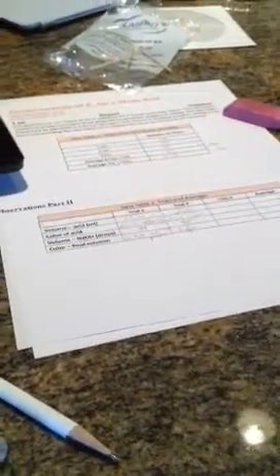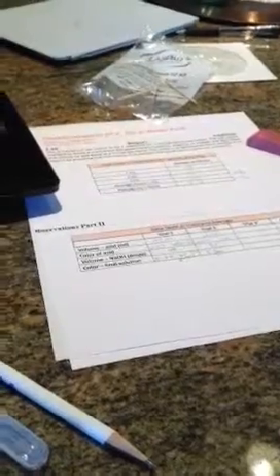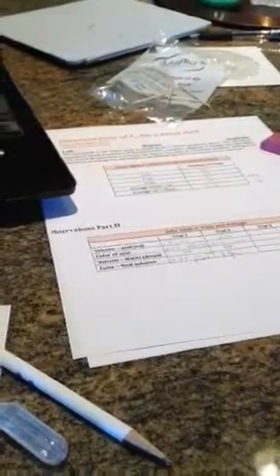Good morning. So we are doing our lab to determine the Ka for a weak acid, and I've done two titrations and have one more left to do. My pH of our unknown acid before the titration was about 3.2, and then the final pH was about 8.5. And I added about 45 drops of my sodium hydroxide to get that titration to stay that pink color.